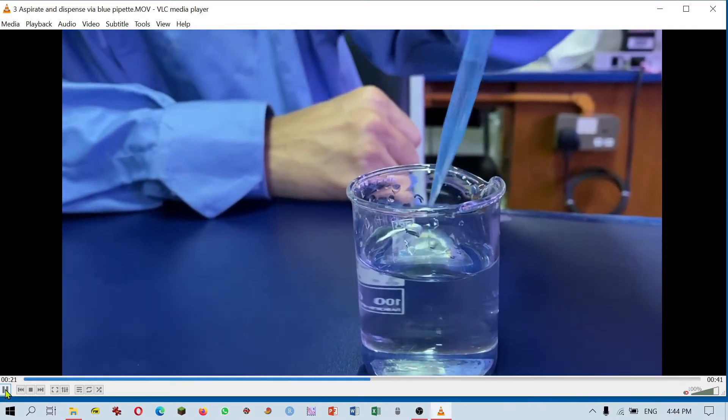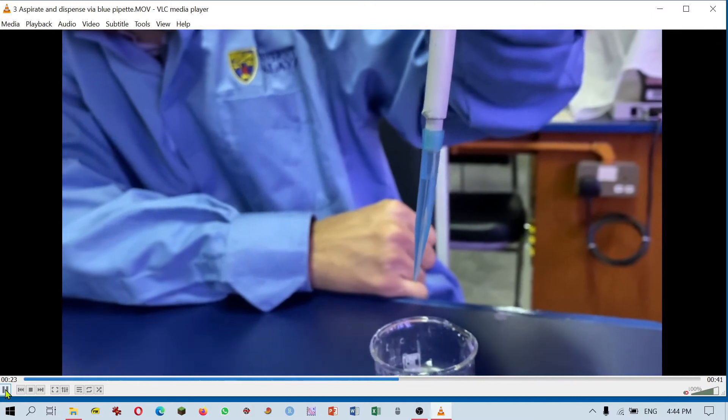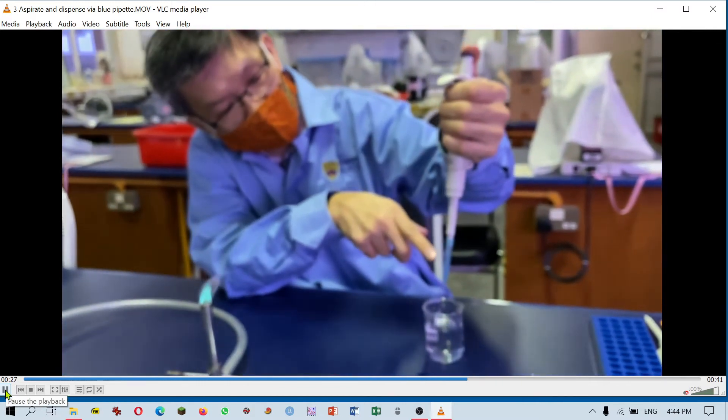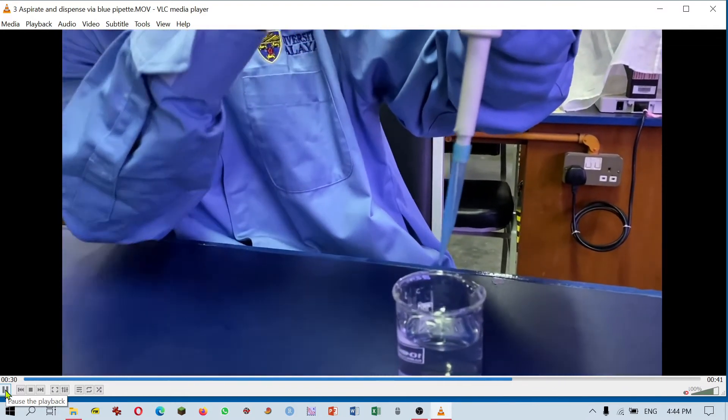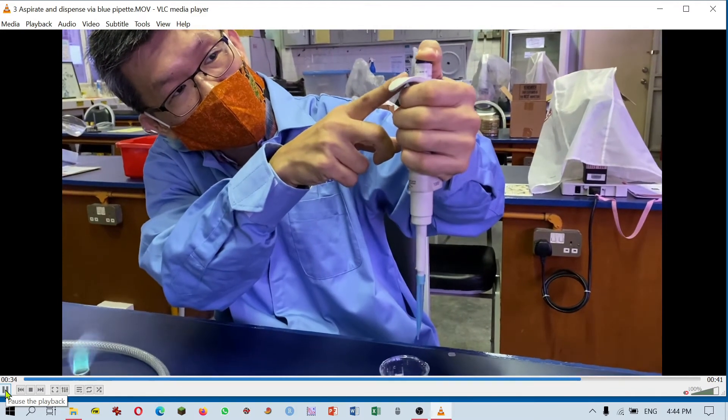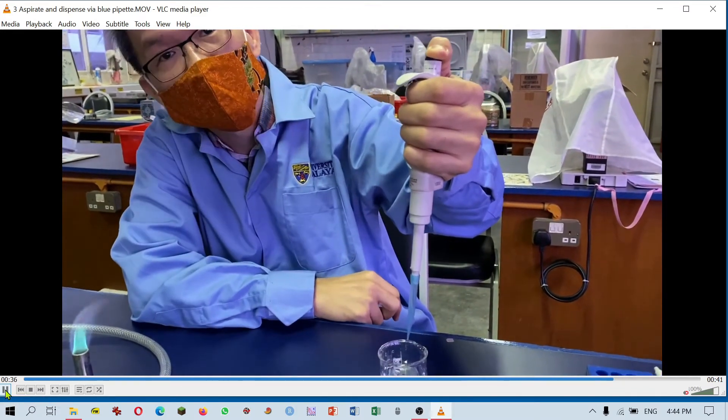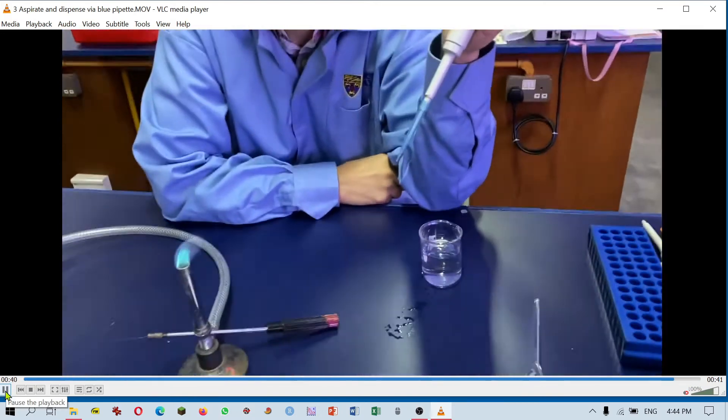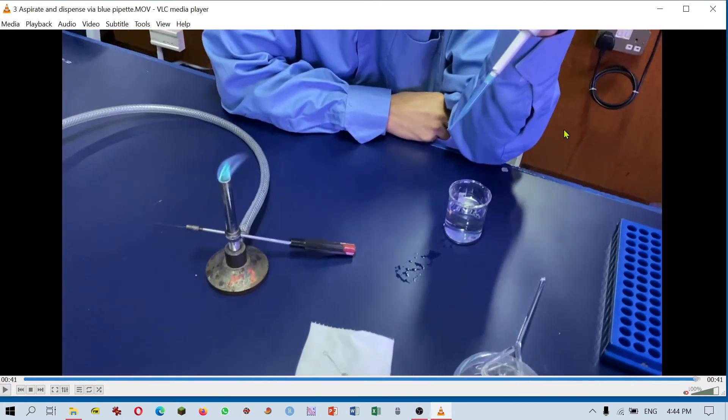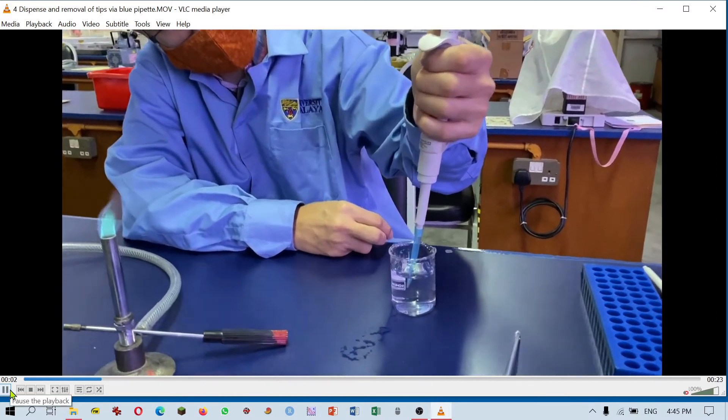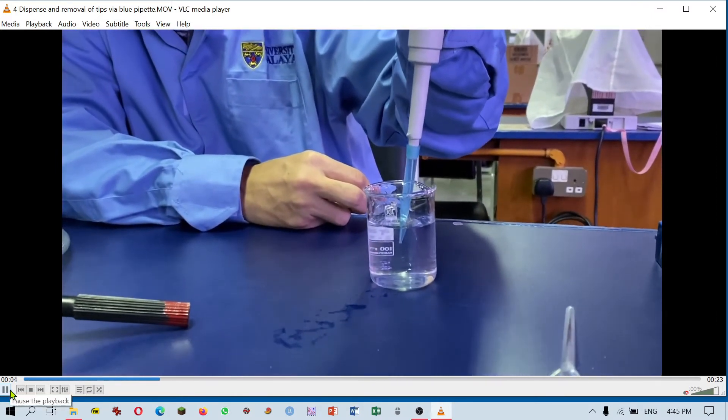When you dispense, you have to press it all the way past the second stop, all the way to the second stop. To aspirate, we press it to the first stop and take up the solution.